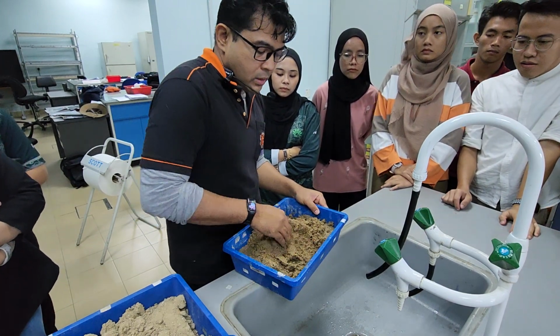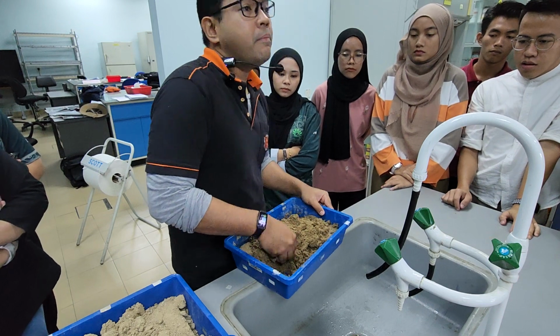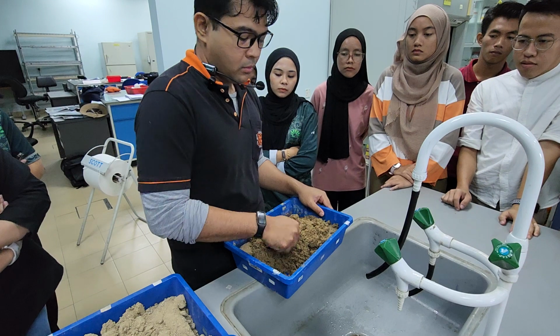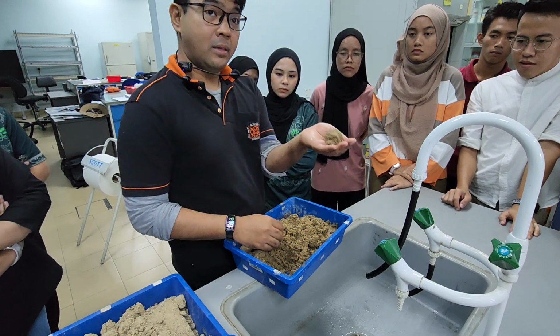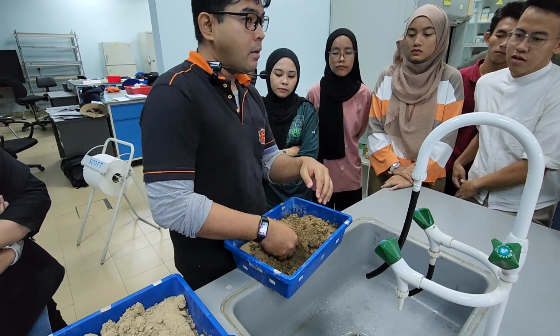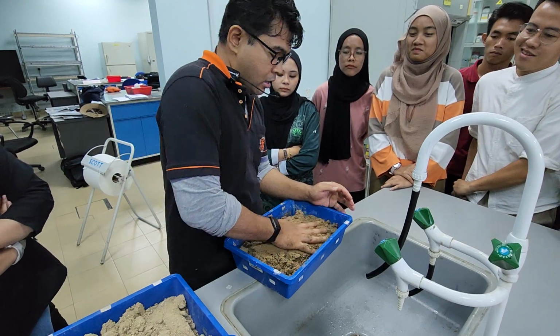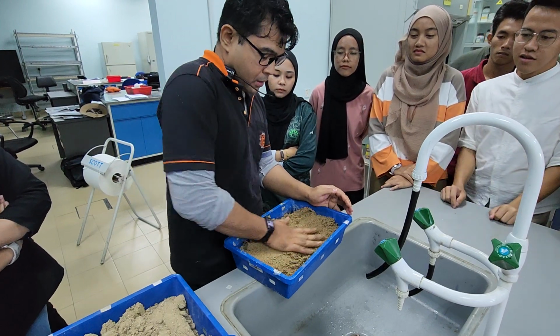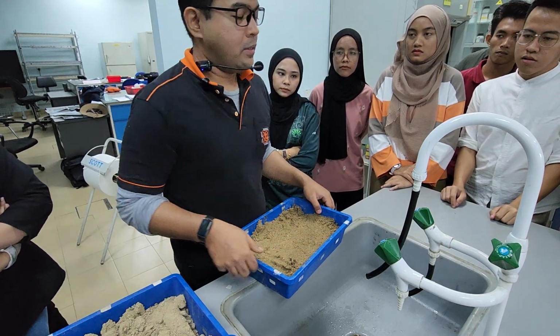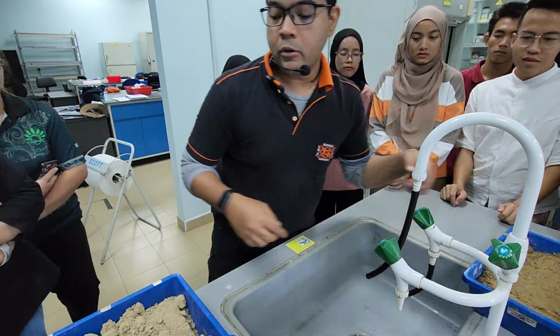So until what consistency should you add your water? Sampai dia boleh jadi ball. More or less. Like this. Okay. Not too much. I don't want to see it jadi aquarium benda ni. Okay. Not aquarium. Okay. Right. Okay. Let's do this. Any group nak buat?